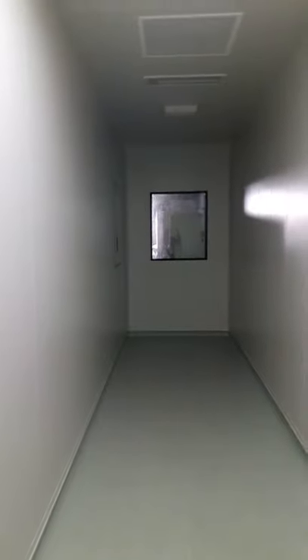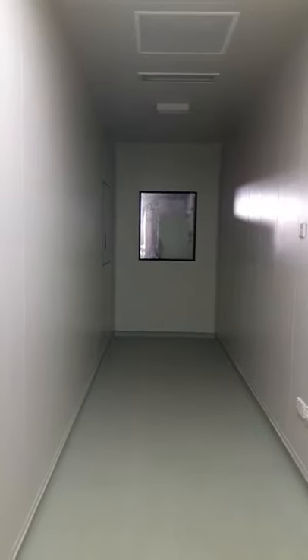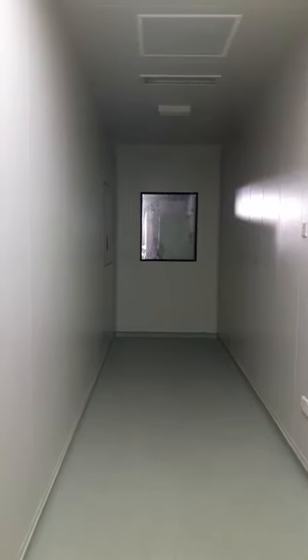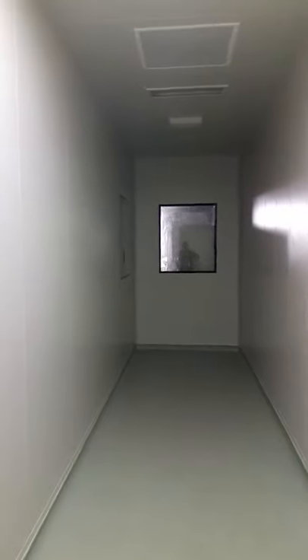I am now in what is known as an airlock. This is basically a region in the laboratory in which we have positive pressure. Positive pressure basically keeps any air out from this area on either side.